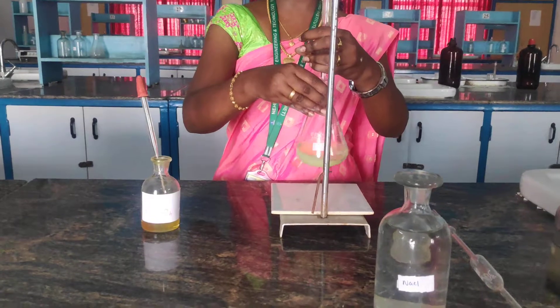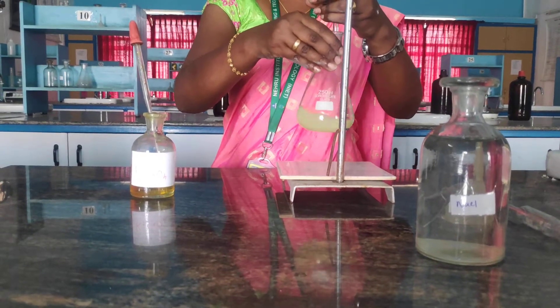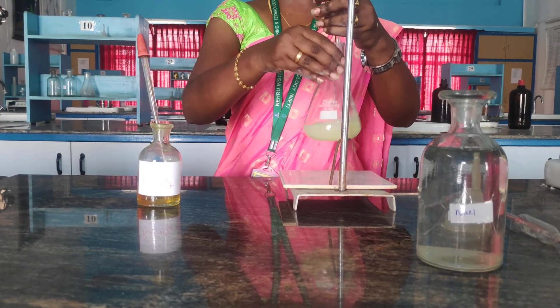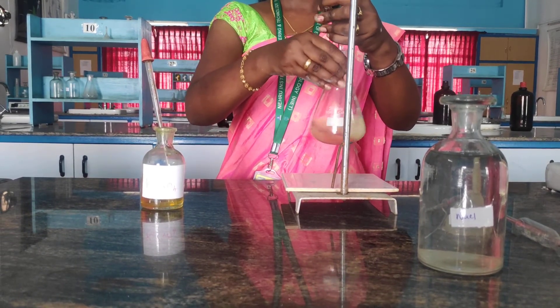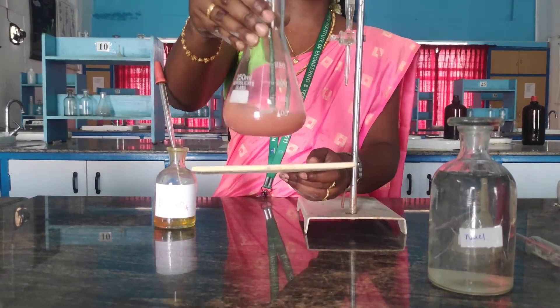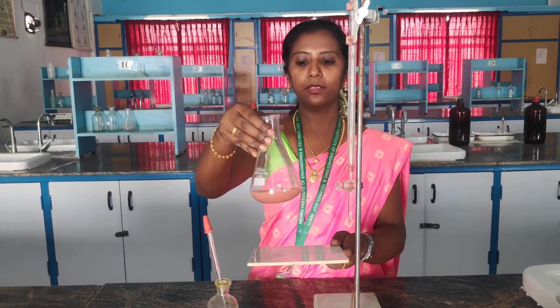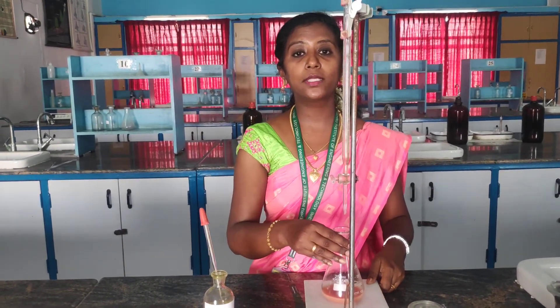As I told you, first we will get a white color precipitate which is silver chloride. When the chloride ions are completely removed from the water sample, potassium chromate — the indicator — directly reacts with silver nitrate and we will get the end point as reddish brown precipitate. You can see we will attain the end point within a short time. This is the end point — you can see the brown color precipitate. In this we have studied about the removal of chloride ions from the water sample. The end point is reddish brown precipitate. We will move towards the calculation part next.